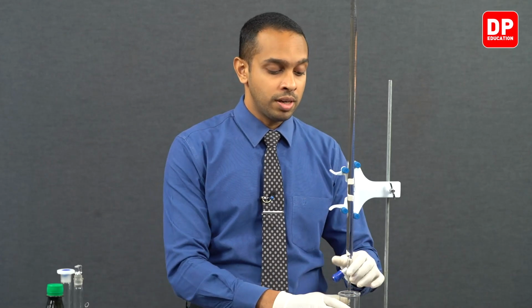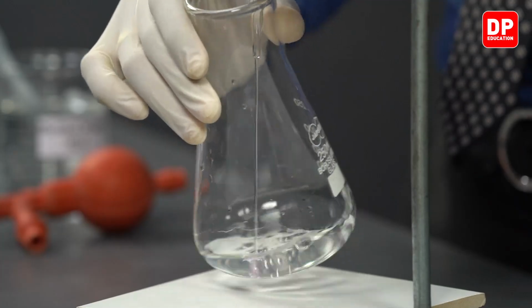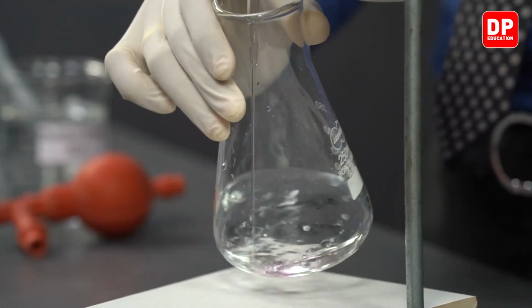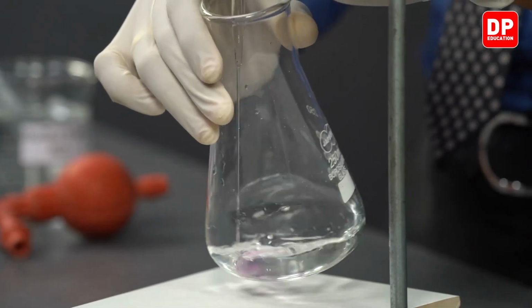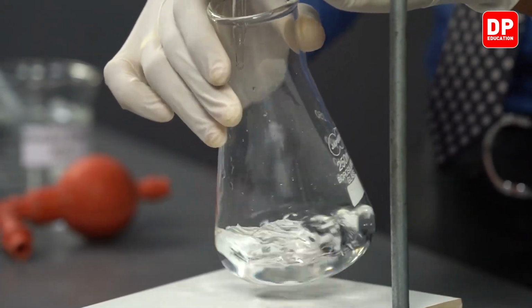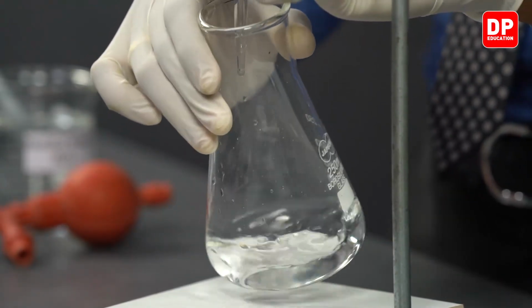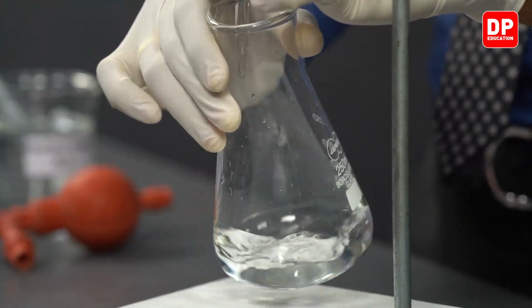However, after that, we are going to take caution, be careful and add sodium hydroxide drop by drop to our titration flask. We can proceed to add sodium hydroxide a little faster, all the way up to around 20 cubic centimeters. As we know, the end point is around 25 or 26.